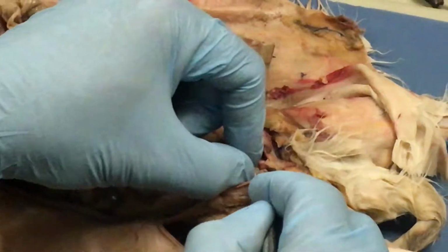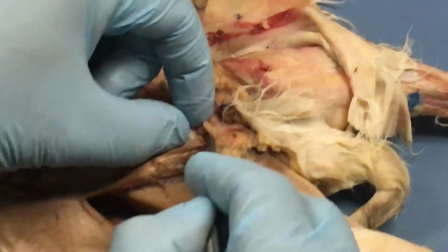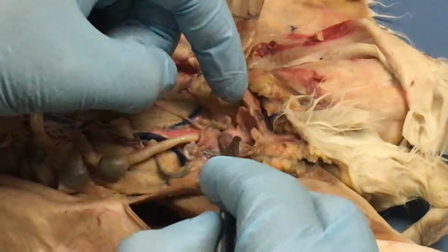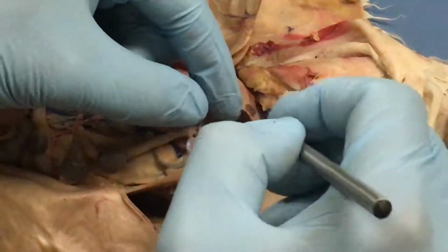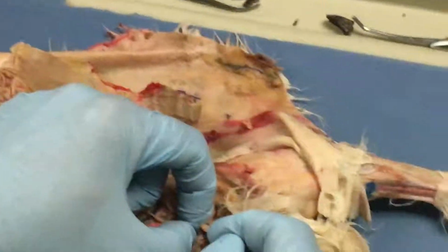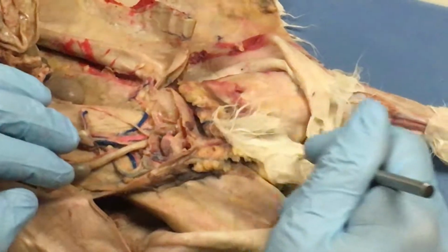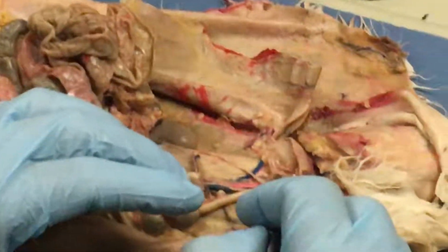As you look at the bladder, you will notice that it narrows into a tube, and I'm going to choose very carefully. If I put that on the lab practical, I'm going to choose one that you can see, and you can't even see it on this particular rabbit. If we were to dig way down in here, we would see that the urinary bladder narrows down into a tube, and that tube goes down in through here. Okay, that's the urethra.